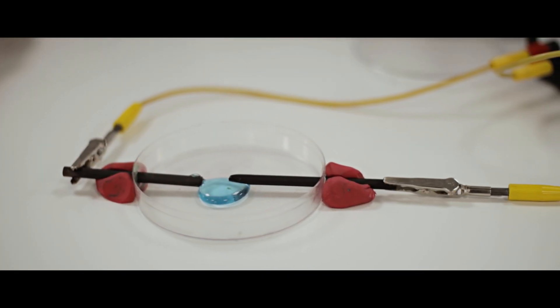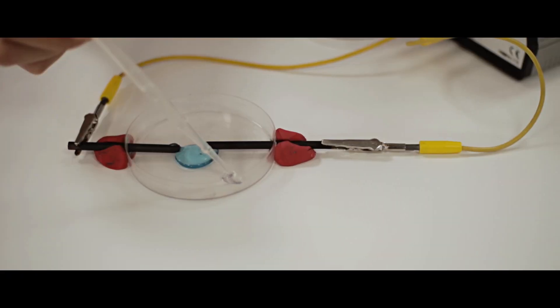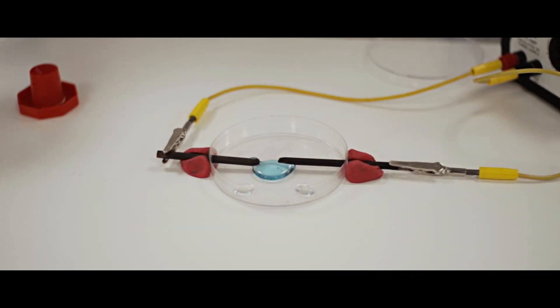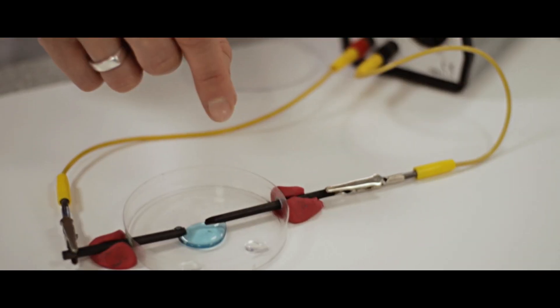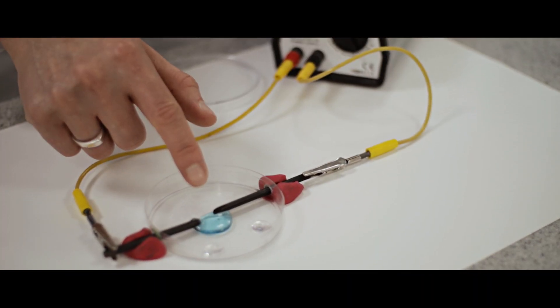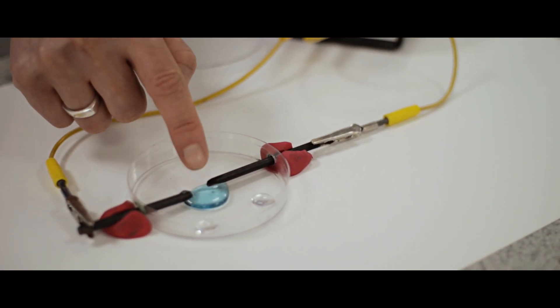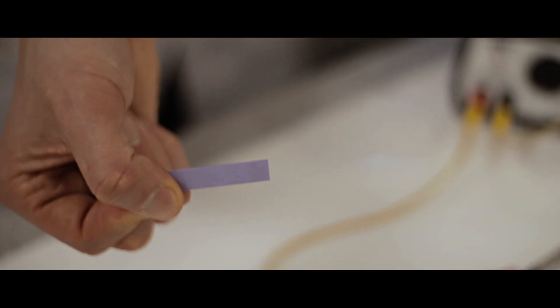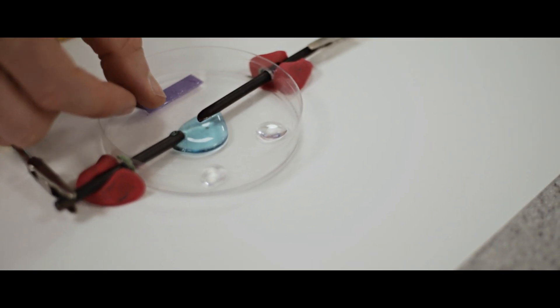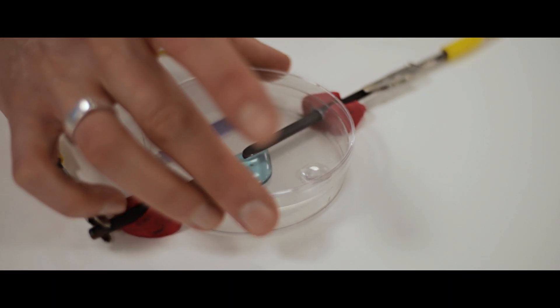To prove the products made in this electrolysis experiment, I'm going to use some potassium bromide and place a drop there, and I'm going to use potassium iodide and place a drop to the other side. Those halogens bromine and iodine are less reactive than the chlorine contained in the electrolyte. If we make chlorine gas, it will displace the bromine and the iodine, and we should see a colour change to prove that displacement has happened, proving that chlorine has been made. Another test we can use is blue litmus paper - if we dampen that down, chlorine gas should bleach the damp litmus paper.